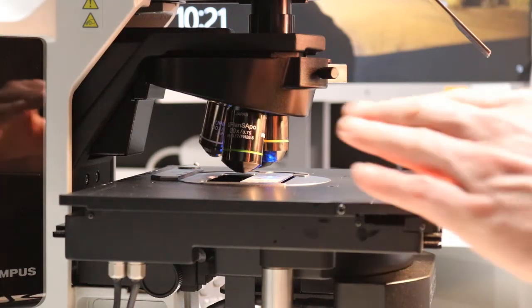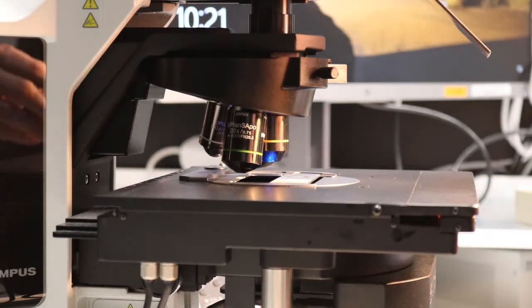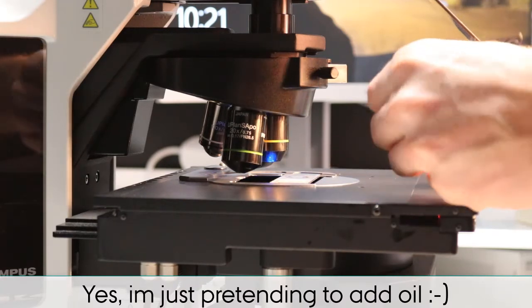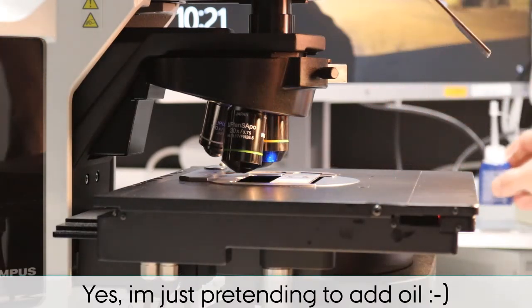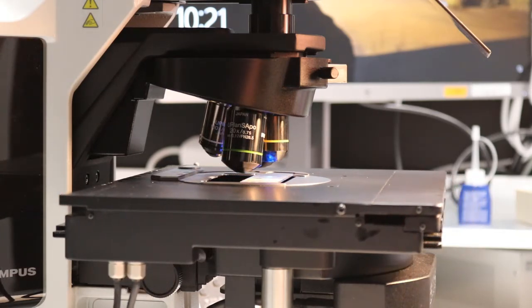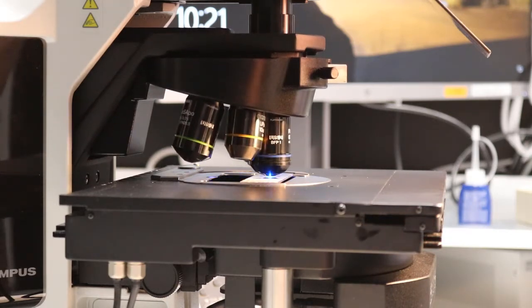Then I can manually take out the stage, and I can add a drop of oil. Then I press go, and it will find the same position again. Then I change to the 60x oil lens, and I'm in the position I chose before.